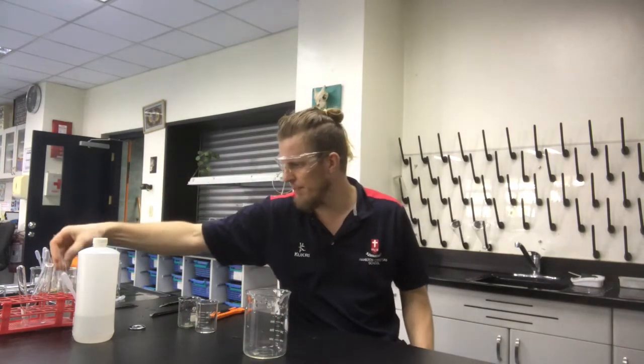In this video I just want to go through and talk about the different observations that we can make when a chemical reaction happens. So we're talking about things like heat and light, gas produced, color changes, and the formation of precipitates. I'm going to go through a bunch of different reactions to try and show you as many of those as possible, and I'll talk through the different observations as I go.